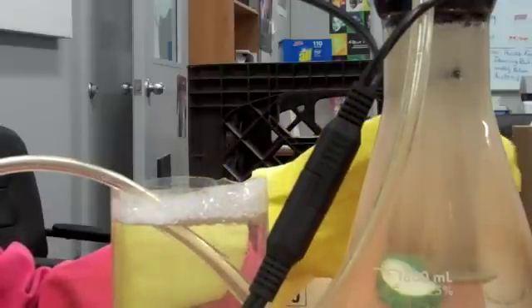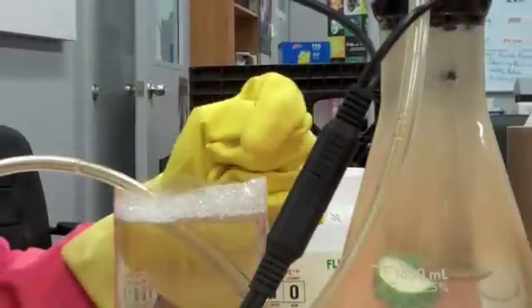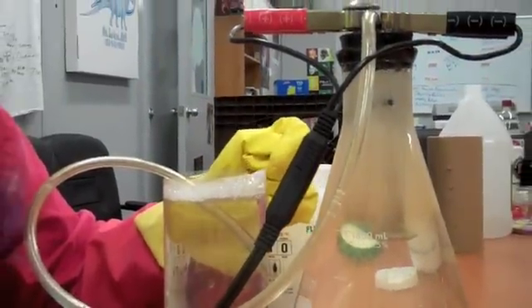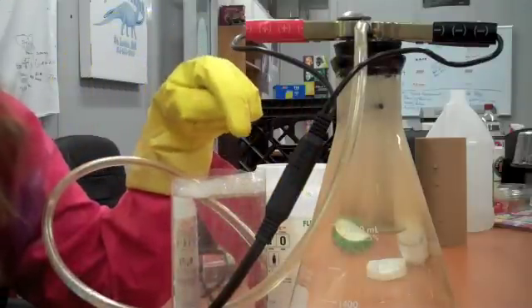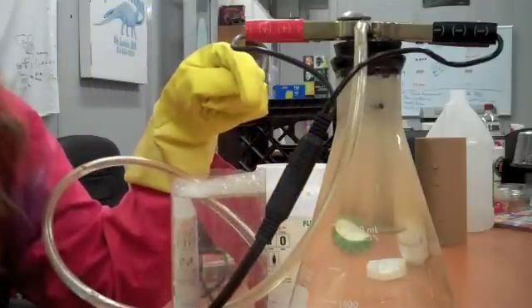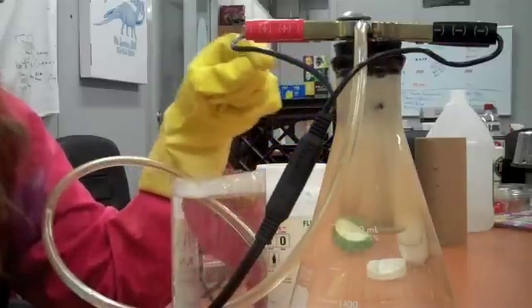The probe with more bubbles on it — twice as many bubbles — has the hydrogen, because H2, there's twice as many of those. It's coming into here, and we can see that there's bubbles building up in the soapy water. Originally this tube just had regular air in it, so some of these bubbles will just be our regular mix of air. But the newer bubbles coming out of here will be hydrogen and oxygen.